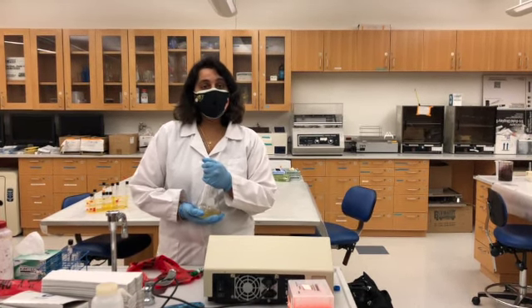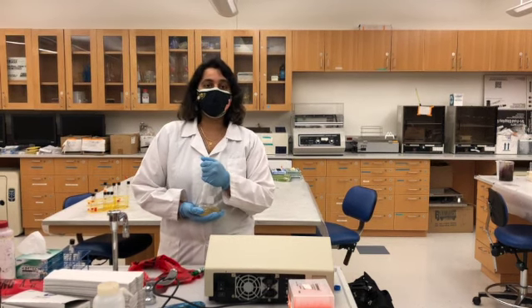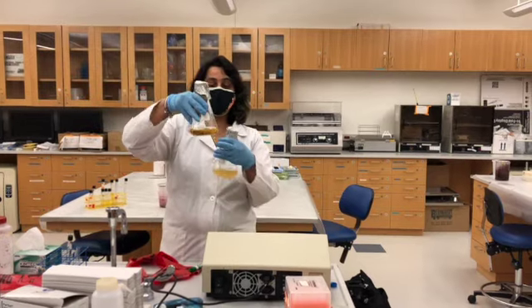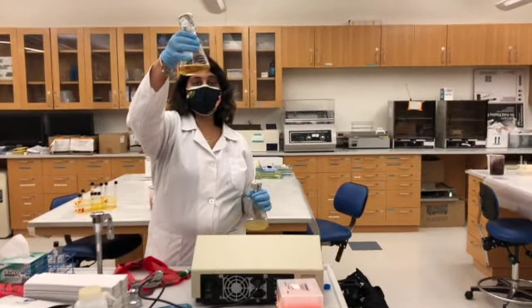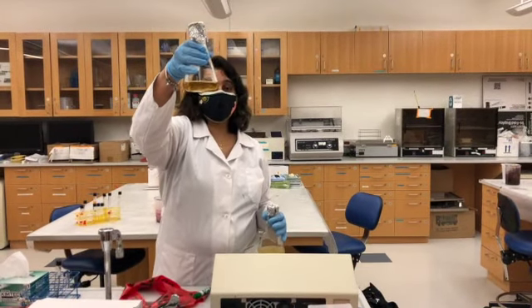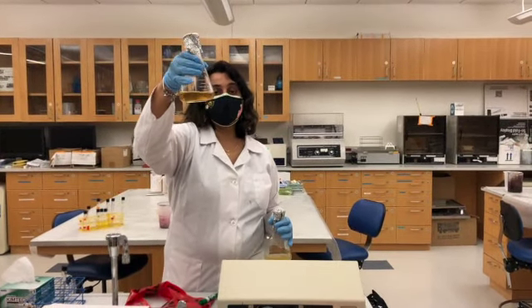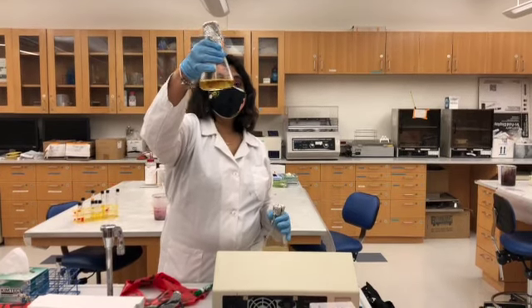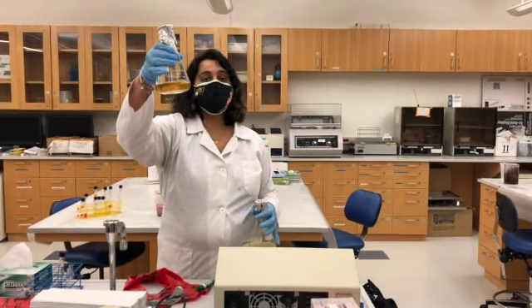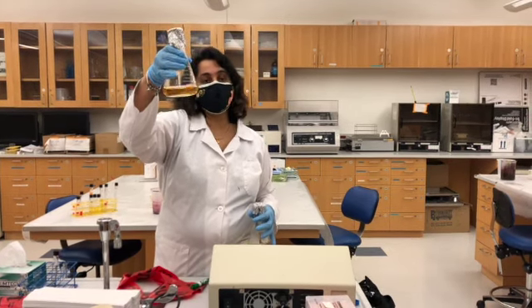So how do you know if the bacterial cells are actively growing or not? You take the sterile media. Sterile media would be something similar to this. This is sterile LB broth. Similar to your tryptic soy agar, this is another bacterial media, food for the bacteria, that is commonly used in labs to grow different bacterial cells.